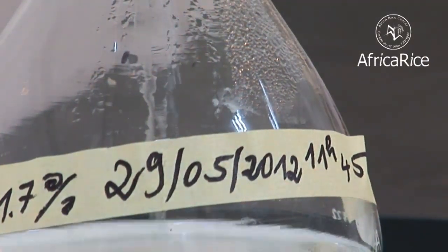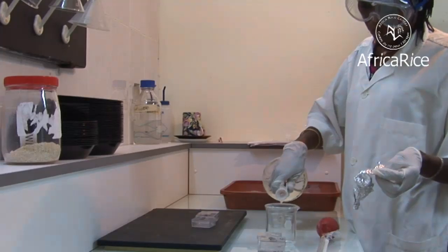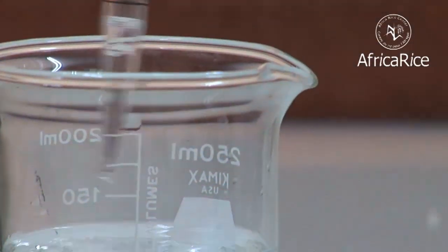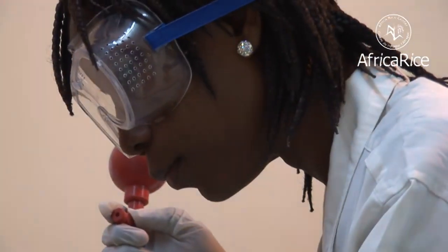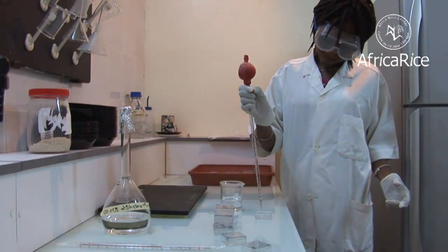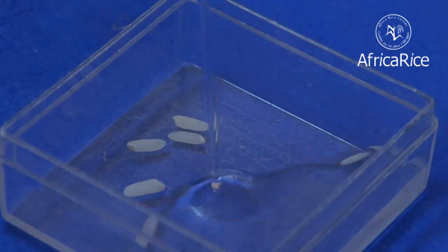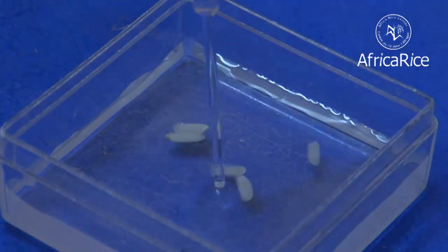The gelatinization temperature of a rice sample gives an indication of cooking time of the rice. This can either be directly measured or indirectly estimated by using the alkali spreading value. A quantity of dilute potassium hydroxide is put on 6 grains in a dish and left overnight.